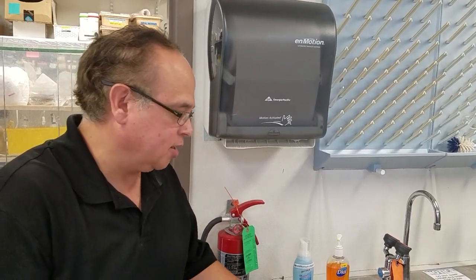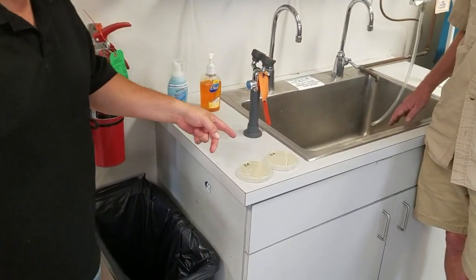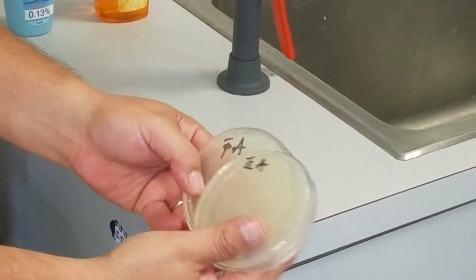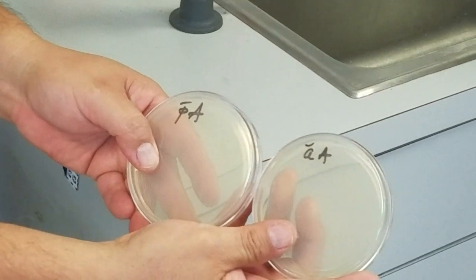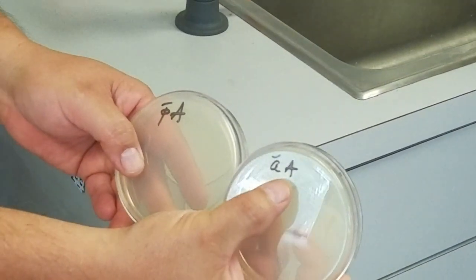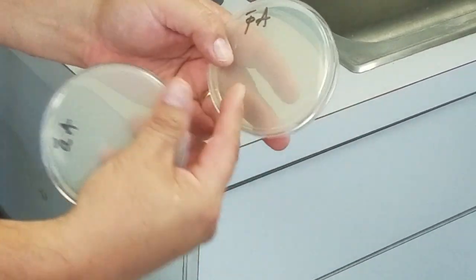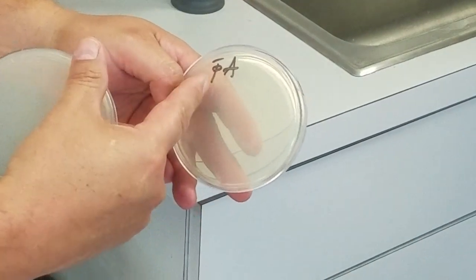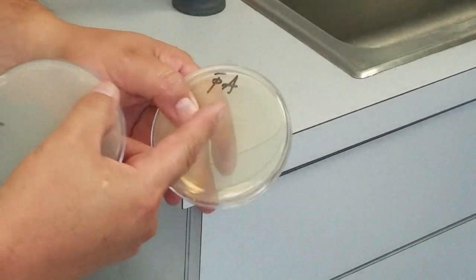Take a look at the plates — I've got them marked already. There is a little A and a big A, which stands for before treatment A. Treatment A is just using water. And here is a little P with a dash over it and an A, meaning after the treatment.